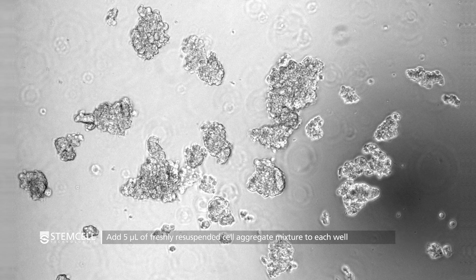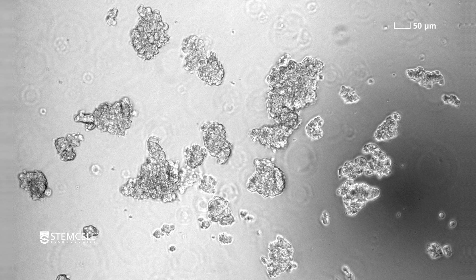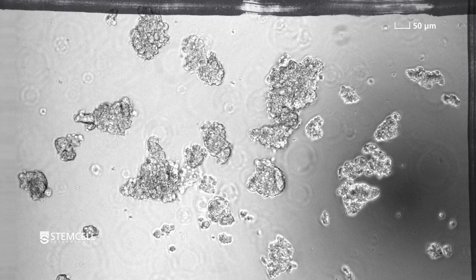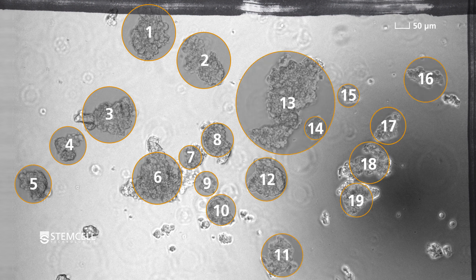Count the aggregates in each well that are greater than or equal to 50 micrometers in diameter. An eyepiece micrometer can help identify cell aggregates of this size. In this example, which represents one quarter of a well as defined by the grid, we have 19 aggregates over 50 micrometers in diameter.